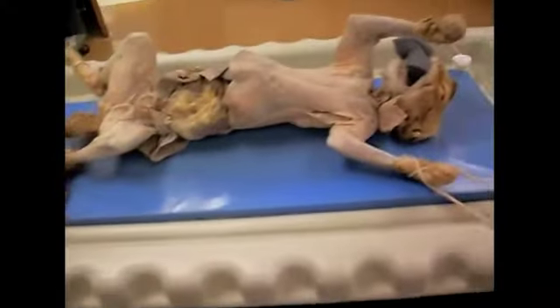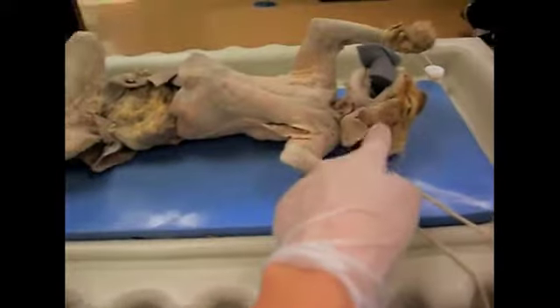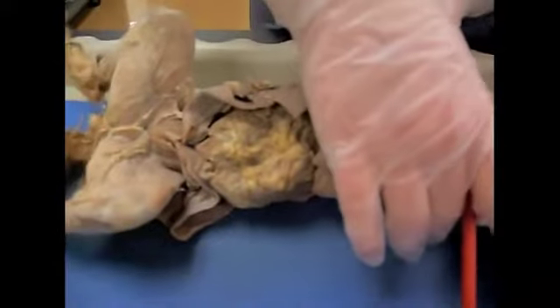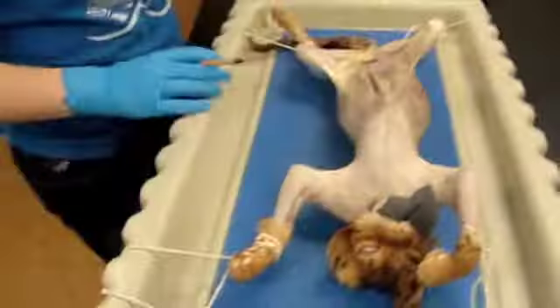Okay, and now we'll tell you the parts or the sections of the head. This is the anterior part, which is the head region, and the posterior part is down here in the leg region, and then the ventral part would be the stomach, right here, and we actually cut him open already, and then the dorsal side is his back.